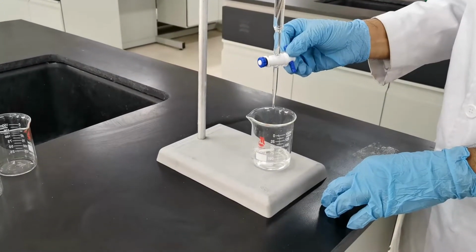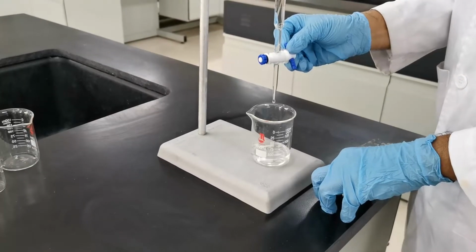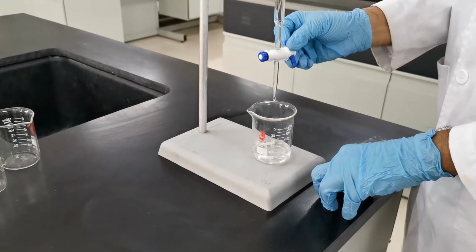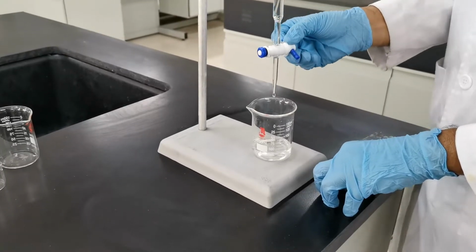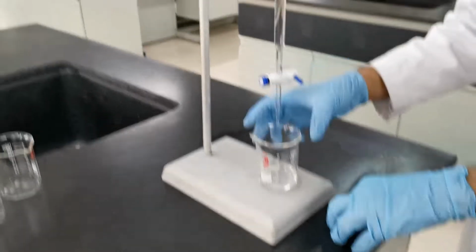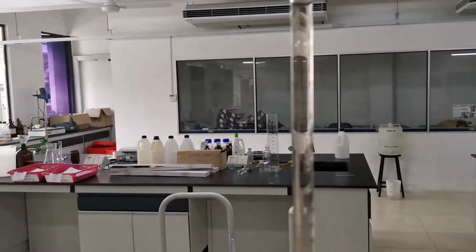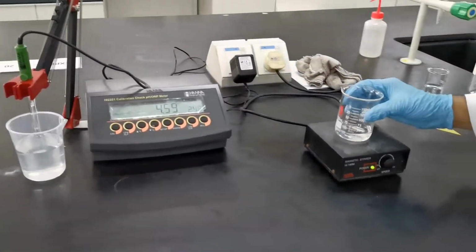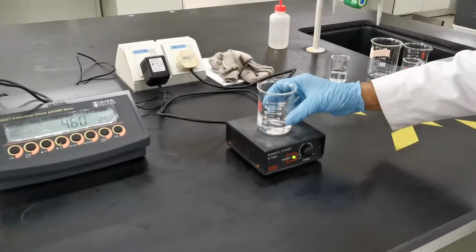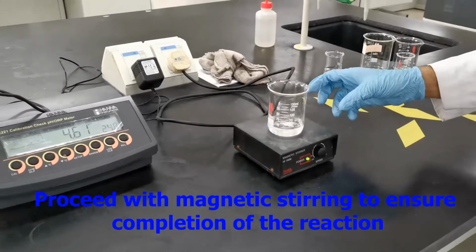Make sure you do this step cautiously since you don't want to add more than 1 ml. It should be exactly 1.00. So we have added 1 ml of the sodium hydroxide solution, and then you need to mix the solution under magnetic stirring so that you will have a homogeneous solution.